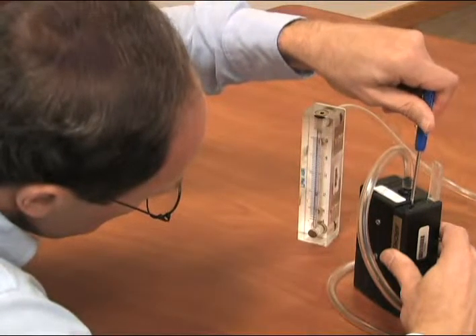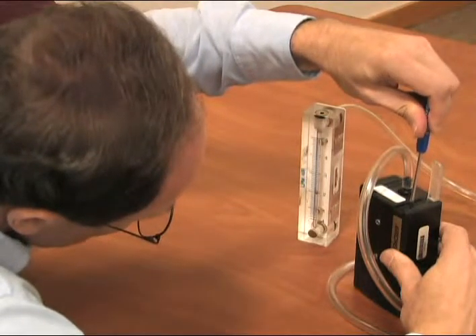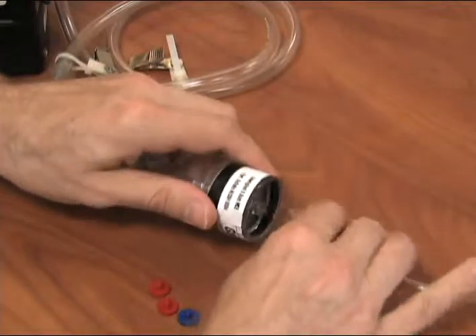Be sure to take your rotometer reading at eye level and use the center of the float for the value. After you are satisfied with the flow rate, your pre-calibration is complete.